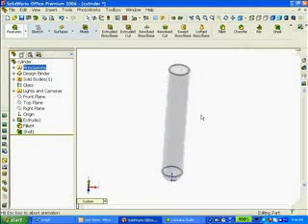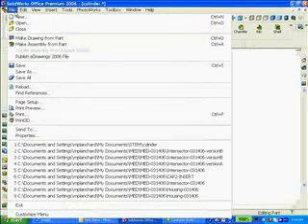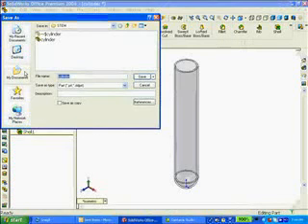Let's display an isometric view, fit the model to the graphics window, and save the file as 16 by 100 millimeter test tube.